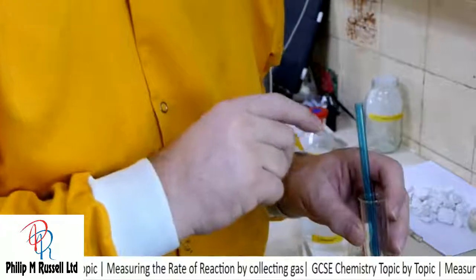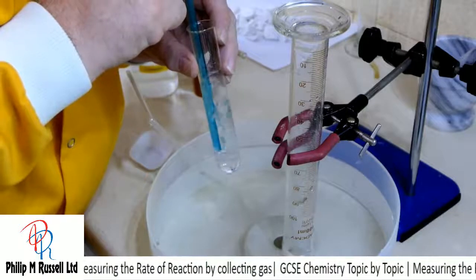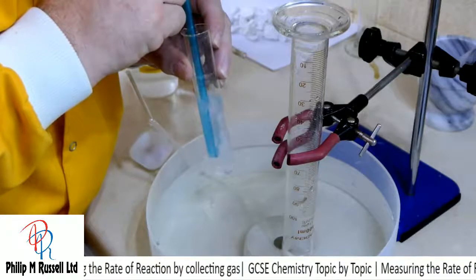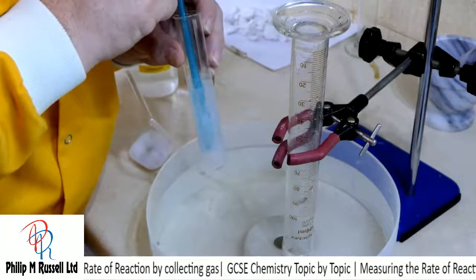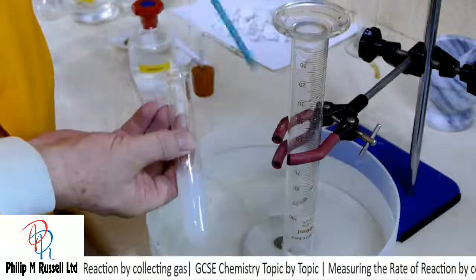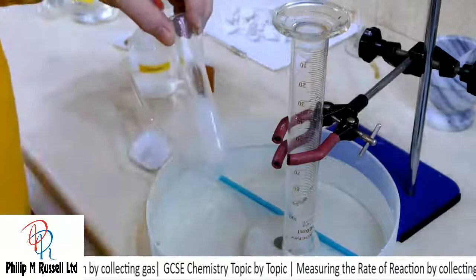I'm going to do it over this water just in case. And thank goodness this time chemistry didn't let me down, and the lime water does go cloudy.